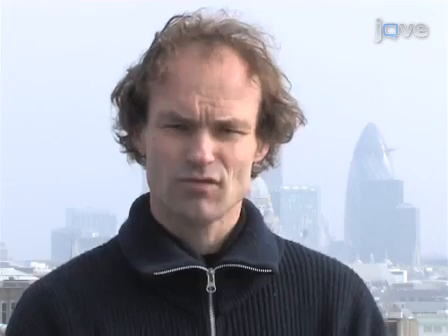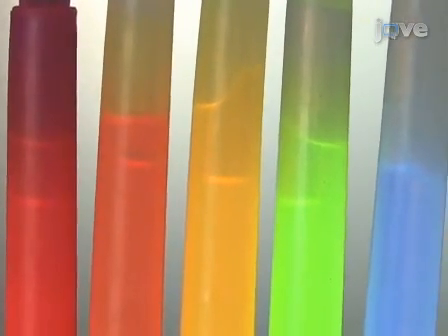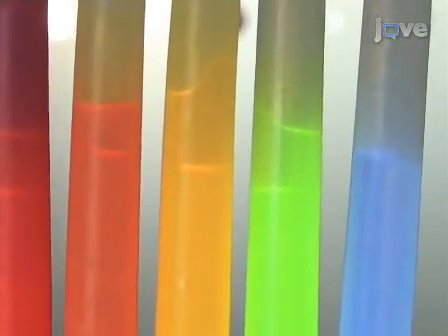Demonstrating the procedure will be Pehuatrung, my PhD student, and Dr. James Levitt, a post-doctoral research assistant in my laboratory. Fluorescence is a multi-parameter signal that can be characterised by position, intensity, wavelength, lifetime, and polarisation. We are particularly interested in the position and the lifetime.